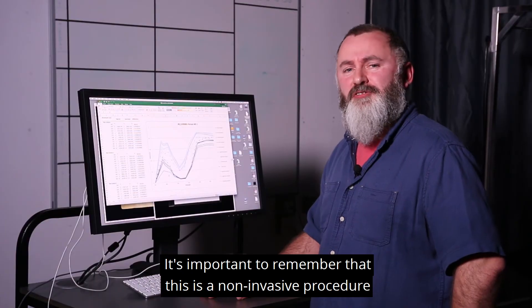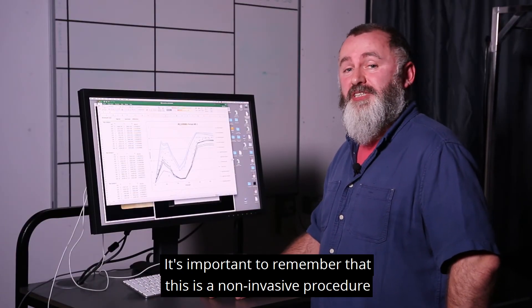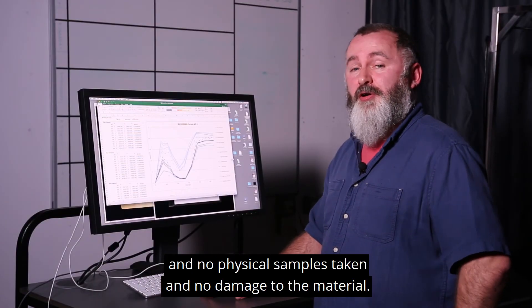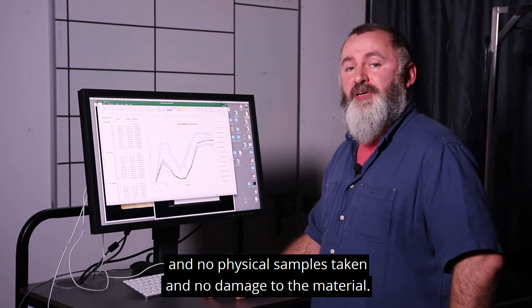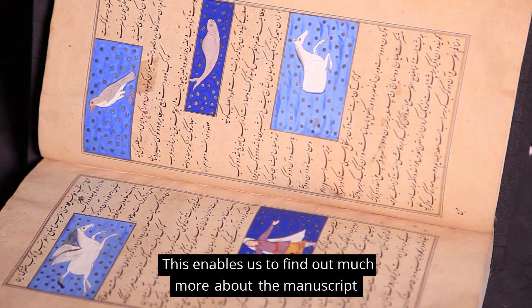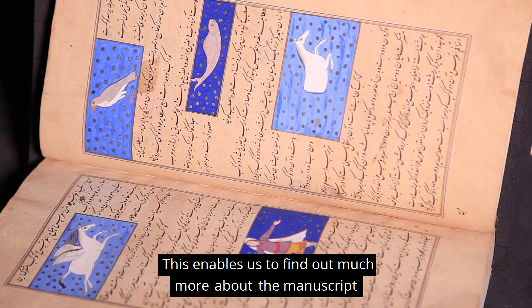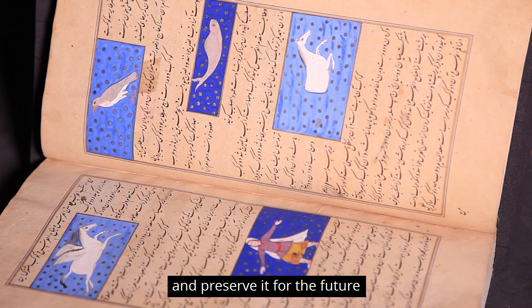It's important to remember that this is a non-invasive procedure. There are no physical samples taken and no damage to the material. This enables us to find out much more about the manuscript and preserve it for the future.